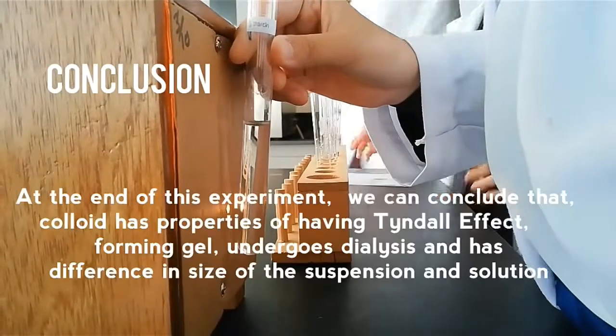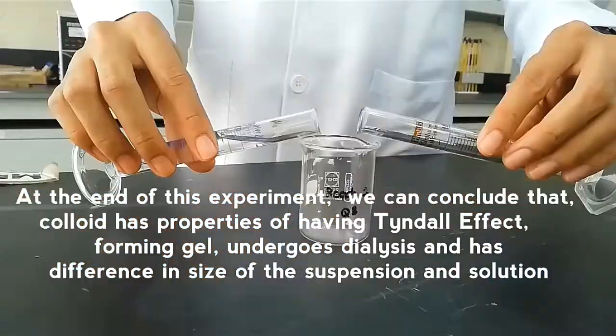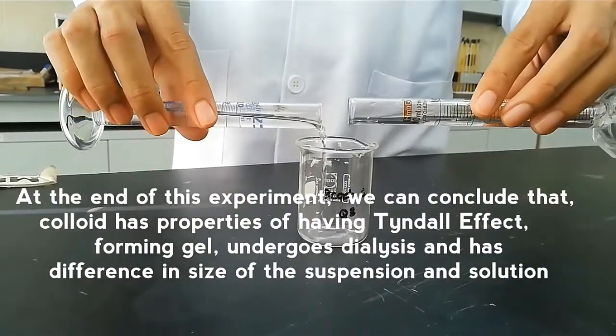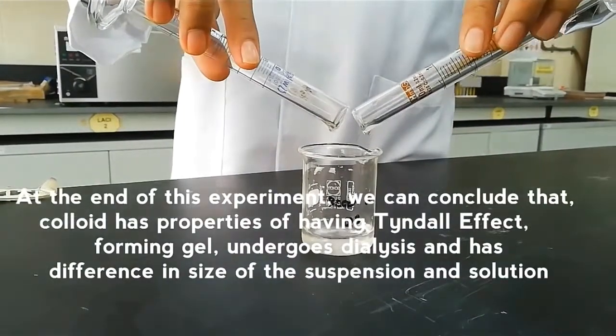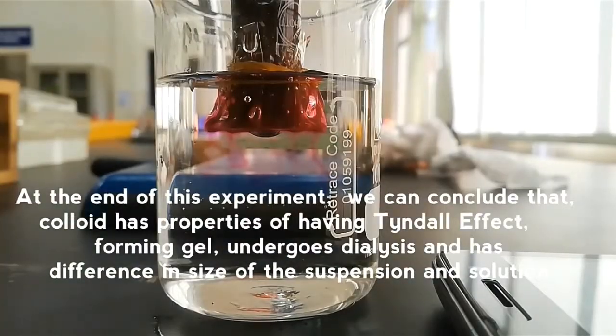At the end of this experiment, we can conclude that colloids have the properties of having the Tyndall effect, forming gel, undergoing dialysis, and having a difference in size from suspensions and solutions.